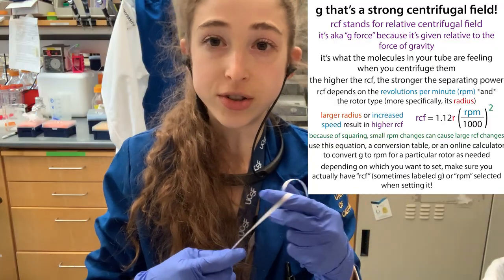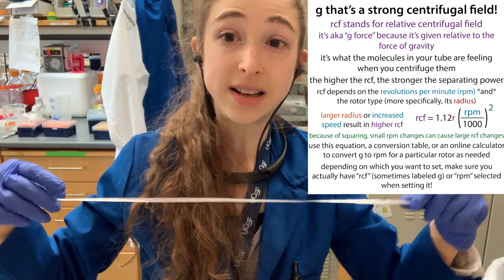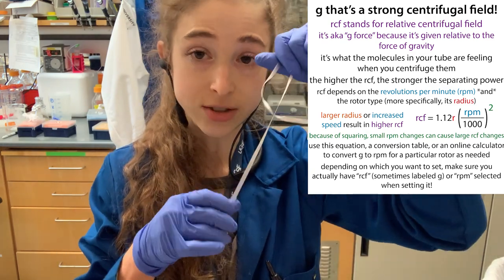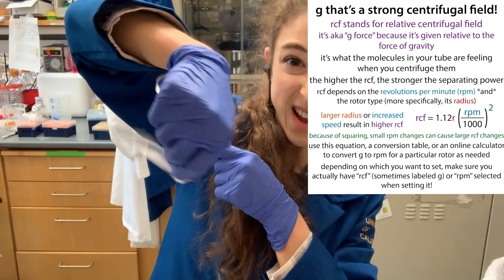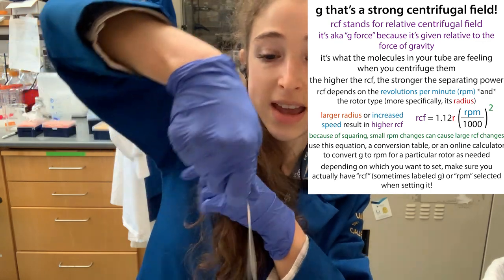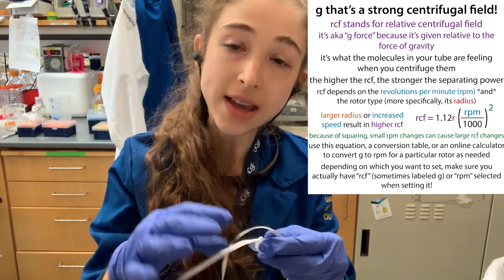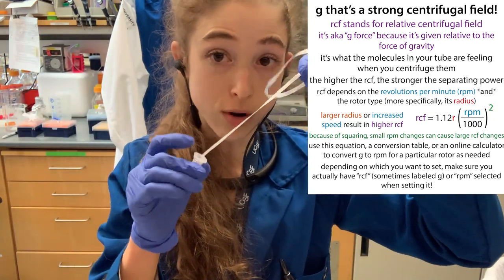We have to decide how much force we want applied when centrifuging, and that's going to be dictated by how fast the rotor is spinning, as well as how far the tube is from the center. If you start spinning faster, that force is going to be greater. And if you lengthen the string, the force at the end of the tube is going to be greater. So how much force is felt depends on the speed — the RPM — as well as the distance from the center of the rotor, the radius.